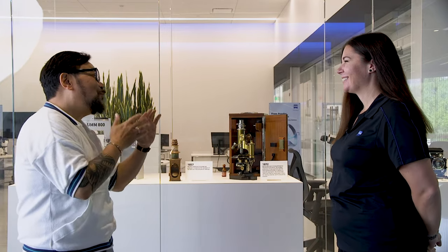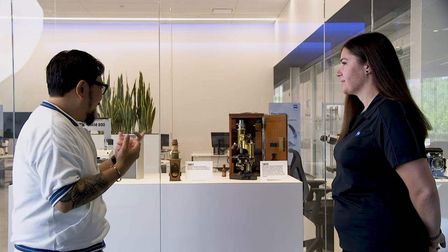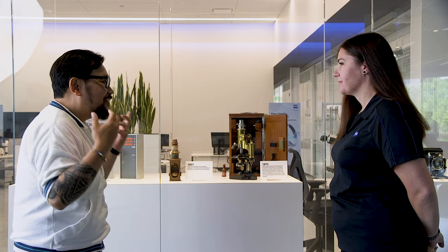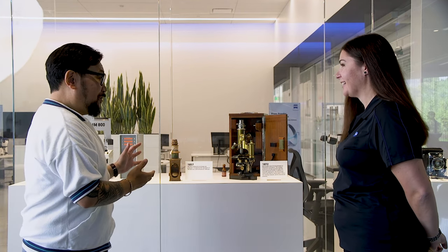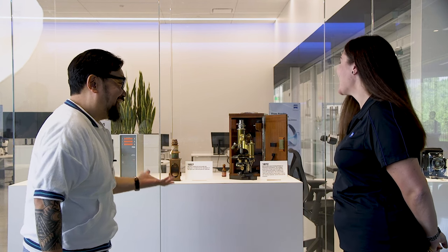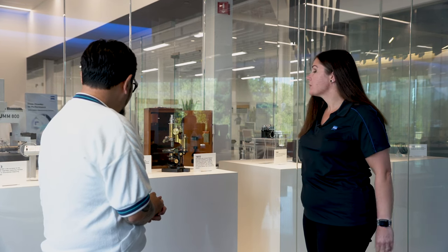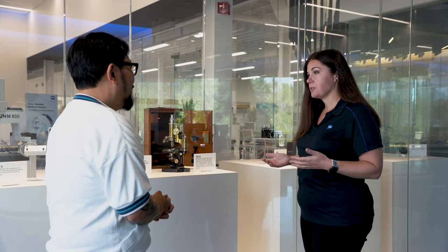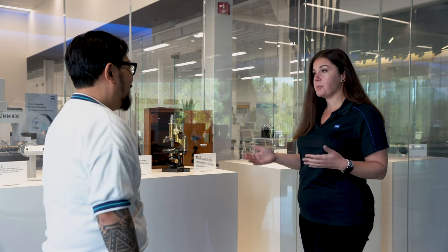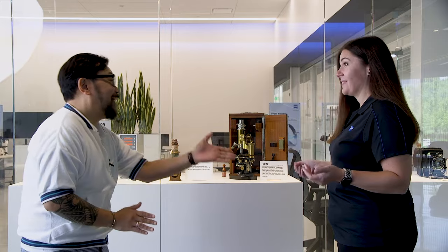Shannon, thanks for your time and letting me understand the principles of light microscopy. We're looking at cool stuff — I love looking at it, but I really don't know what we're looking at. Can you help us understand? Sure. So these are some of the original microscopes that Carl Zeiss made in his lab in Germany. Originally when microscopes were first developed, they used the light of a candle and a mirror to illuminate your sample, and then people would draw on a piece of paper what they were seeing in the eyepiece. That sounds like a manual process — we've come a long way since then.